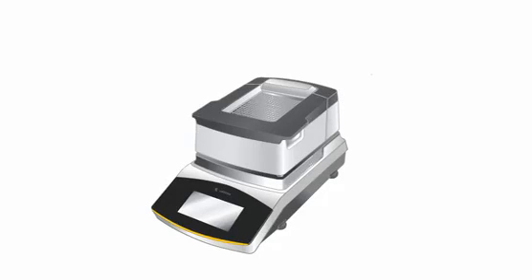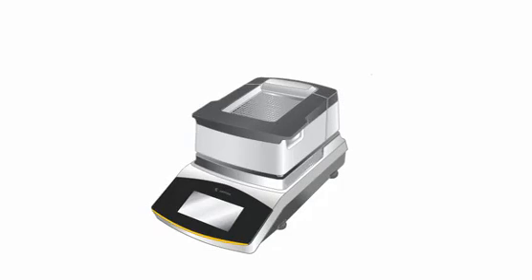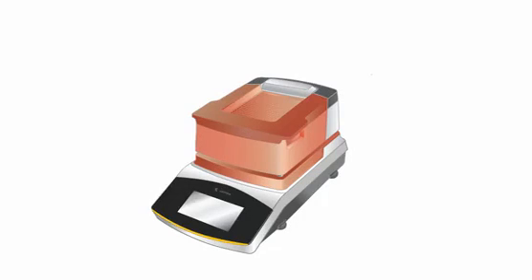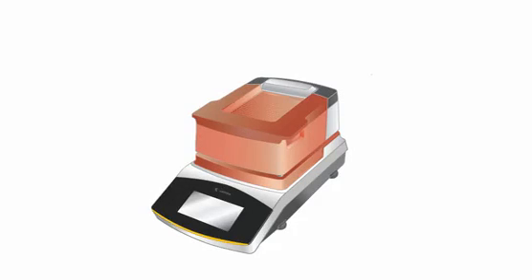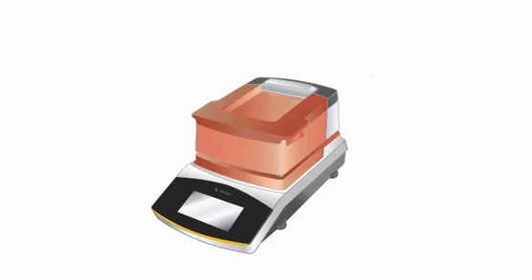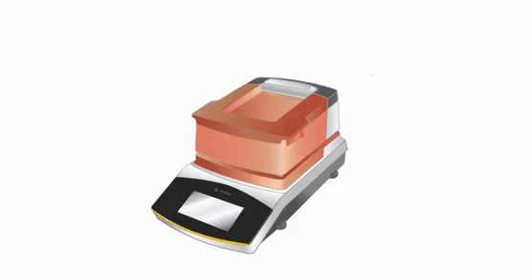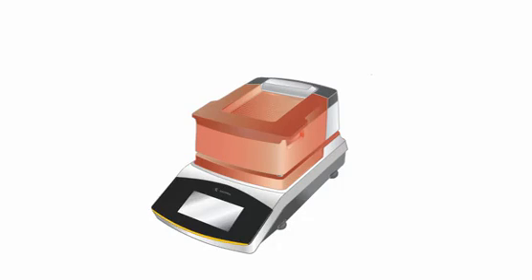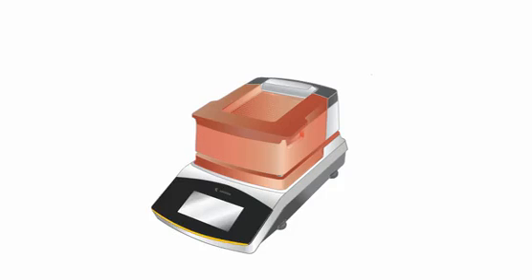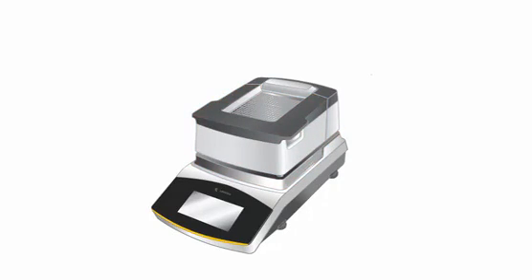Cleaning the moisture analyzer MA-160. The hood of the MA-160 is dishwasher safe, as well as the sample chamber plate. Remove them from the device and, together with the sample tong, they can be easily cleaned in a dishwasher.